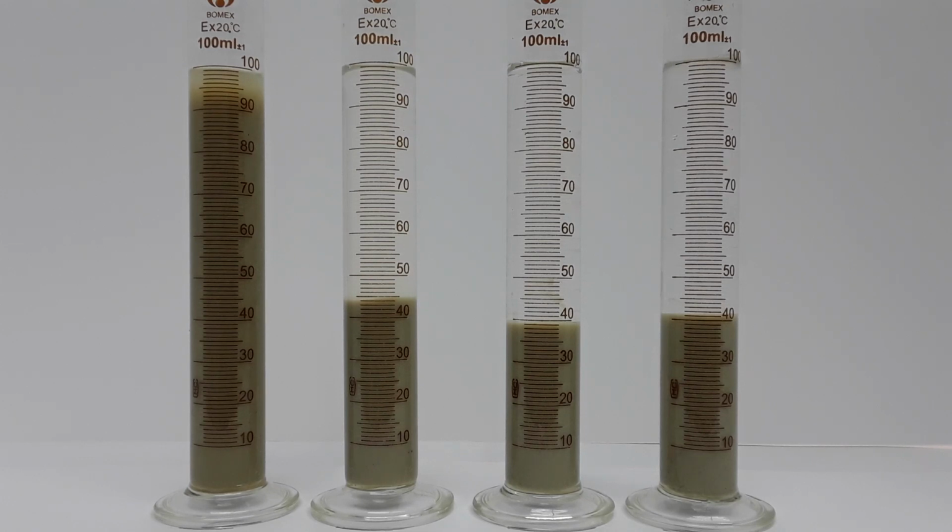We are often asked about supplementing seawater with potassium chloride substitutes for added protection against clay swelling. This demonstration showed that clay swelling and clay stabilization is not the biggest issue we face with the introduction of seawater to reservoir mineralogy. Seawater does just as good a job as clay stabilizers and an even better job than 2% potassium chloride equivalent solution.